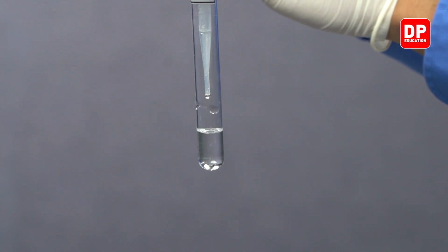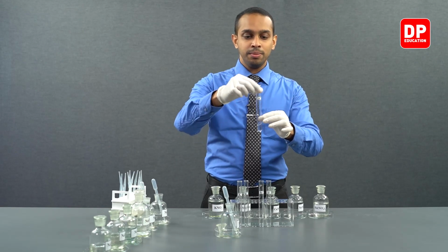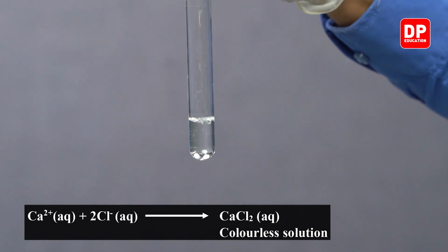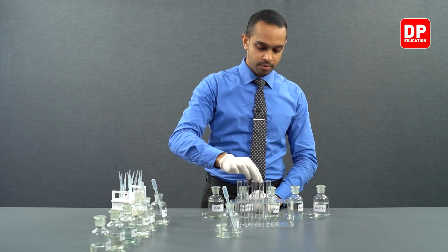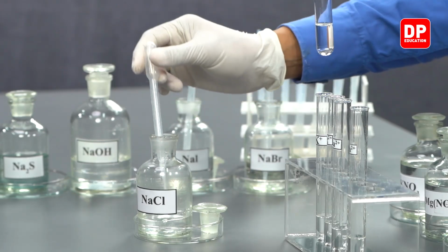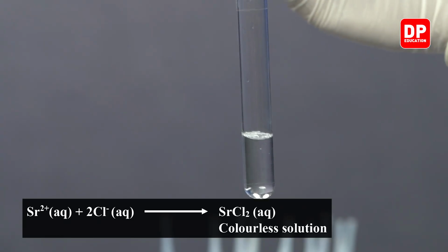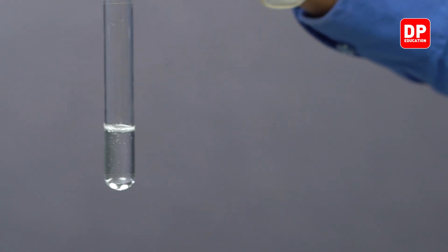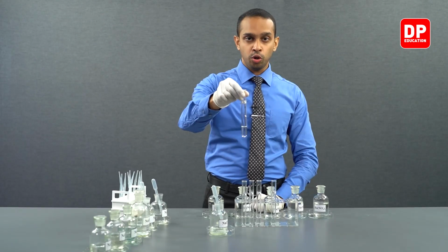So right now I am adding sodium chloride to calcium 2+ aqueous solution. You can see there is no precipitate formed. There are no traces of any precipitate. We have a strontium 2+ ion solution. Let's add a few drops of sodium chloride. As you can see, when you add a few drops of sodium chloride to strontium 2+ aqueous ions, there is no precipitate formed.